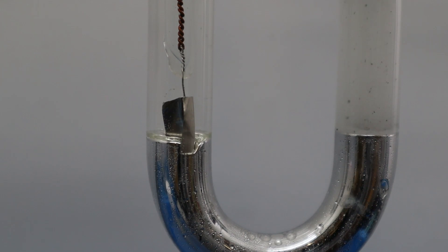Once the gas bubbles become larger, a few gas bubbles still can be seen on the surface of mercury and would finally rise upward and go into the water.